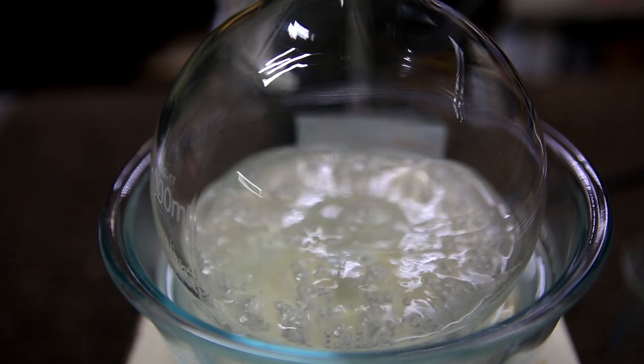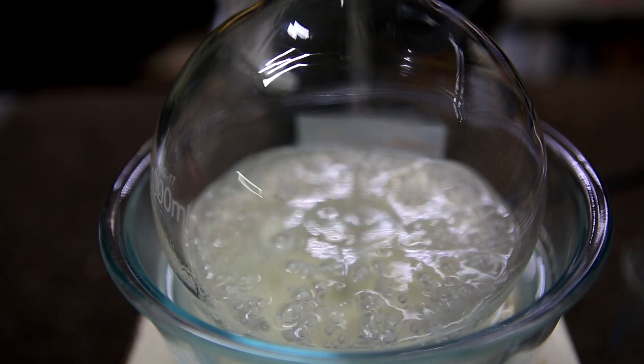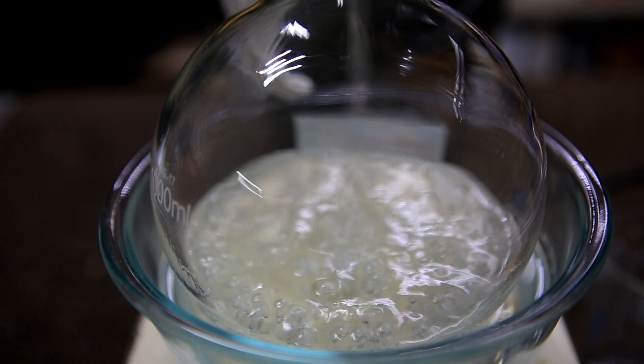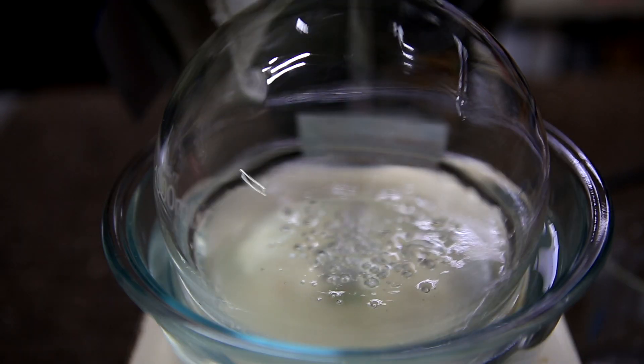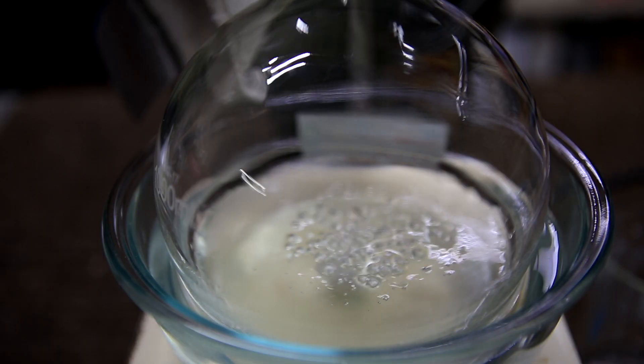So, by keeping the water bath at about 55 degrees Celsius, you should know the distillation is complete when it ceases to bubble. When the bubbling became very slow and no methylene chloride came over, I stopped the distillation.